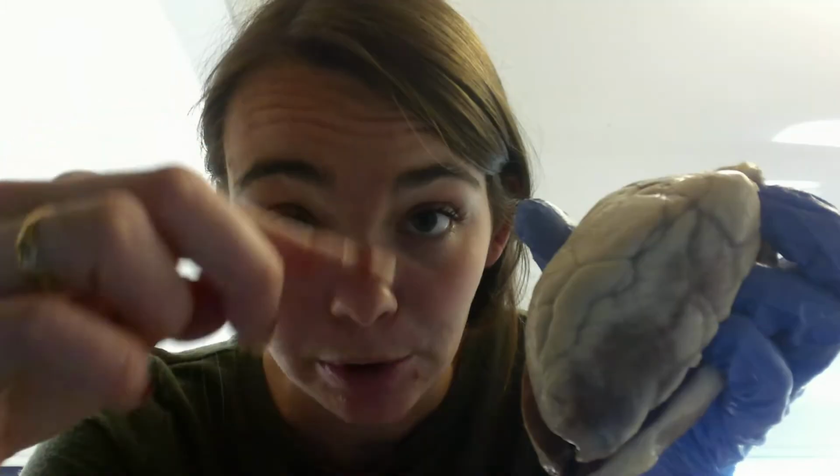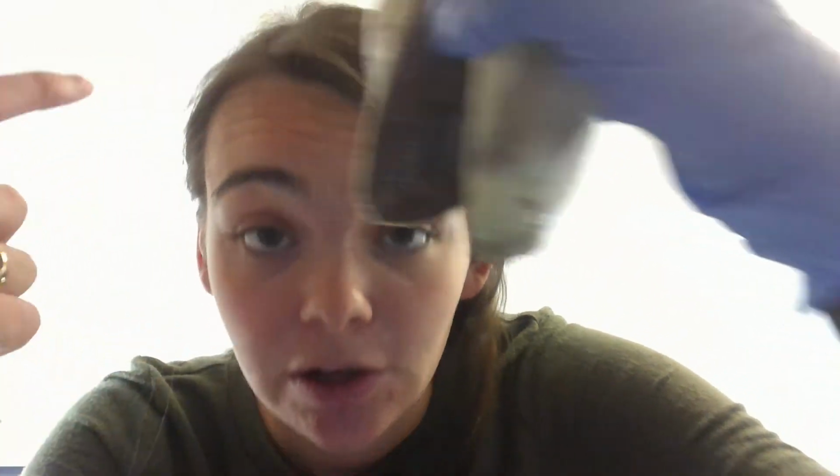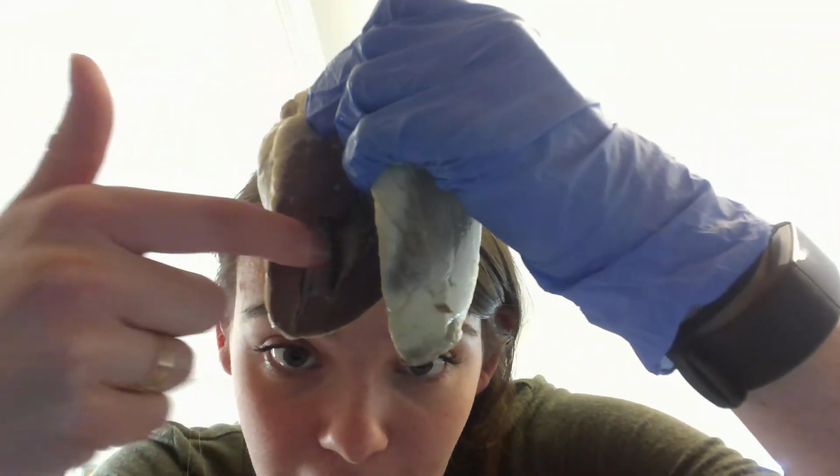And so then you can see just on the outside of the heart here, you have the epicardium, it's just the layer surrounding. And if you look inside, this darker tissue, this is the muscle. This is called the myocardium. So it's the muscle that actually does the work. And then you can see a slightly different color, the lining of the ventricle here. That is called the endocardium.